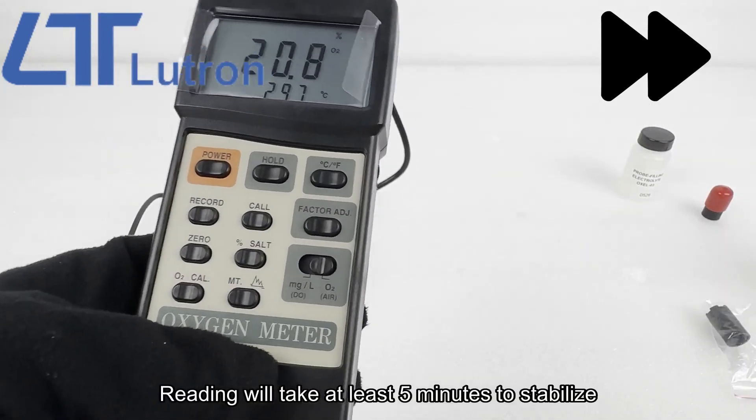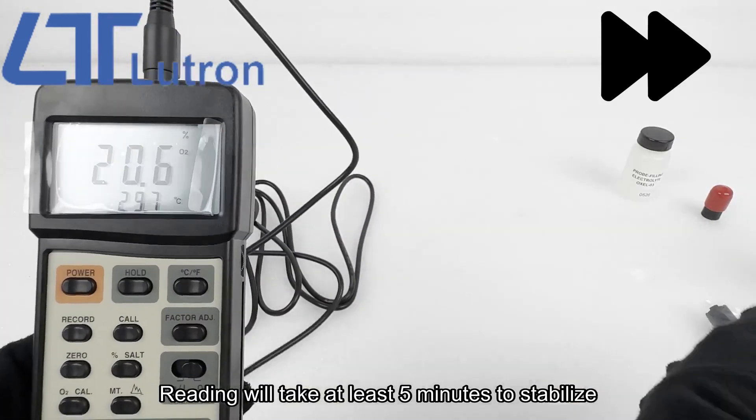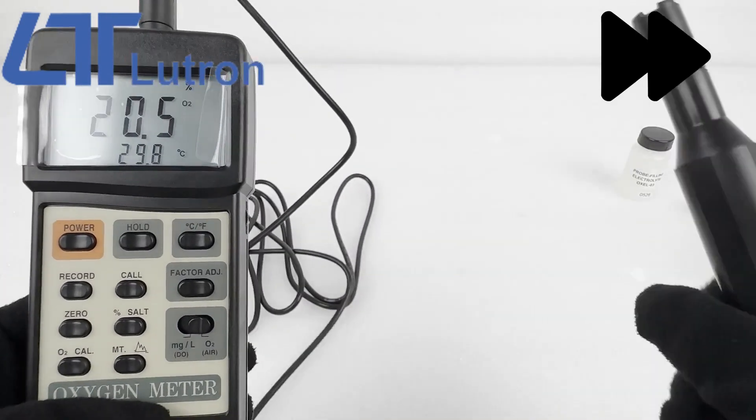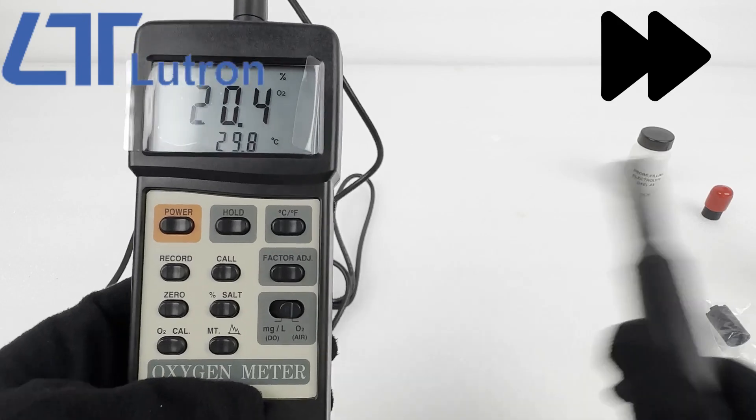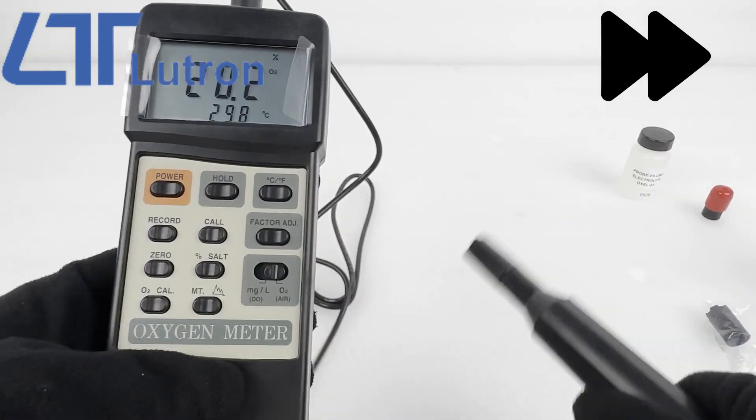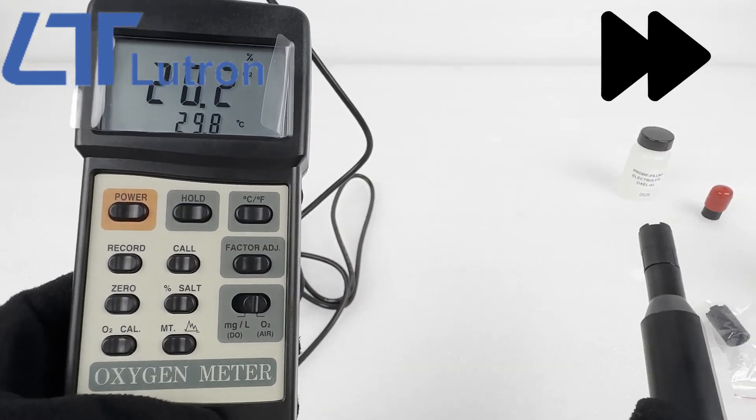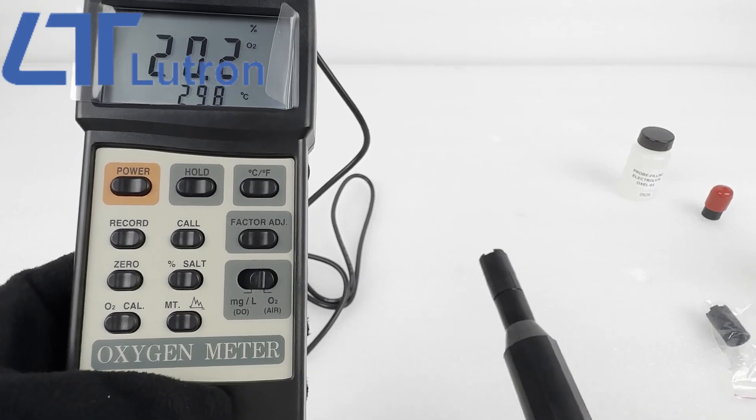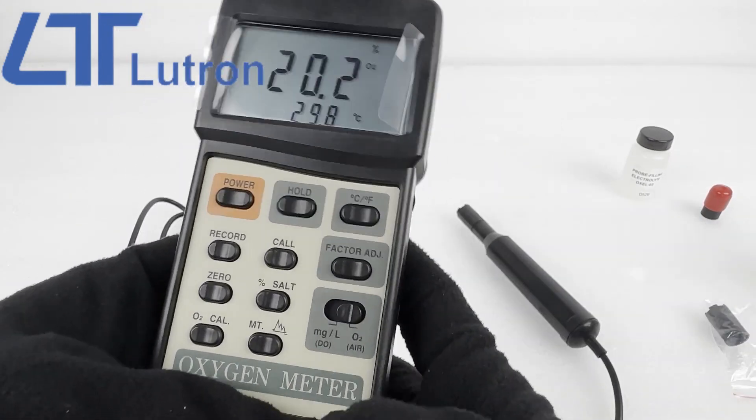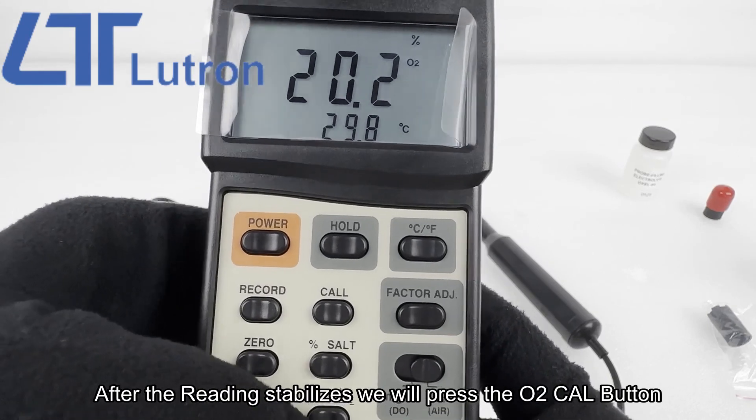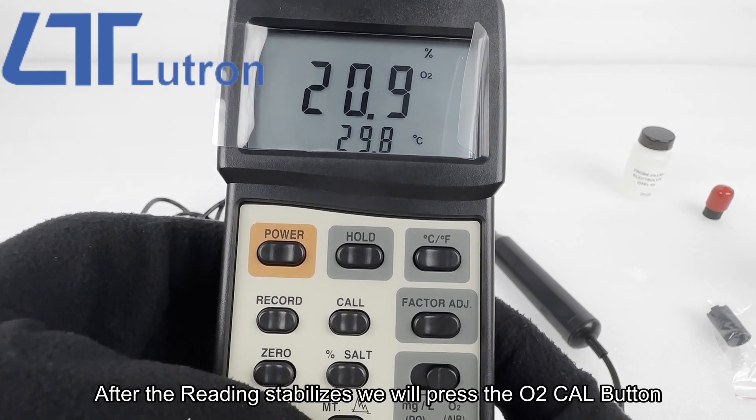After the reading stabilizes, we will press the O2 cal button. The reading will take at least 5 minutes to stabilize.